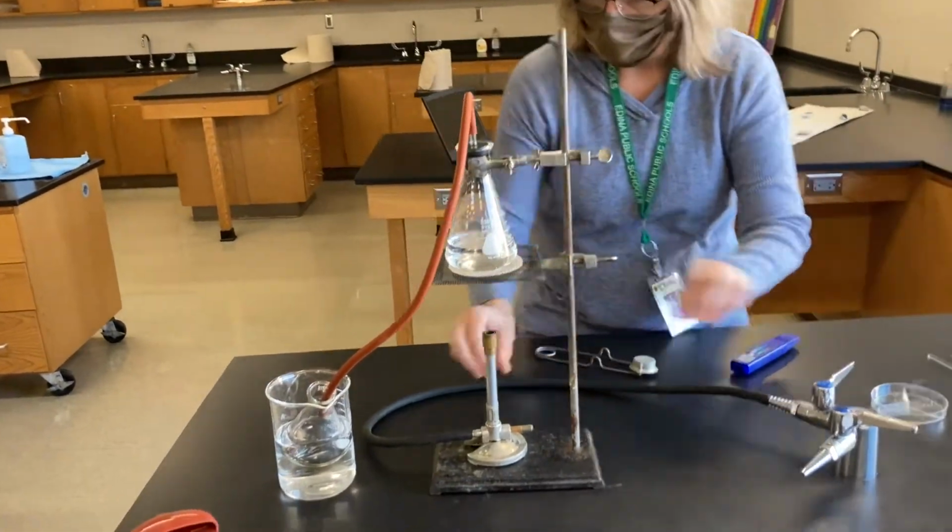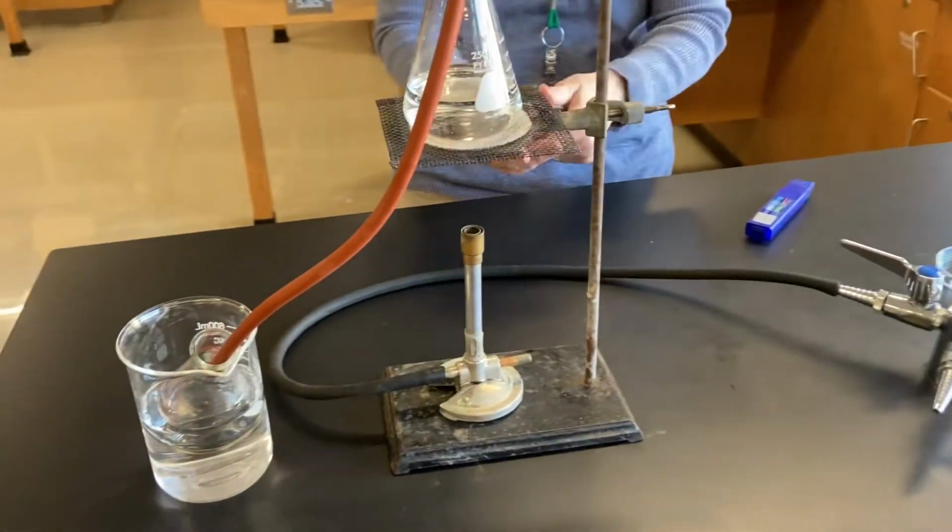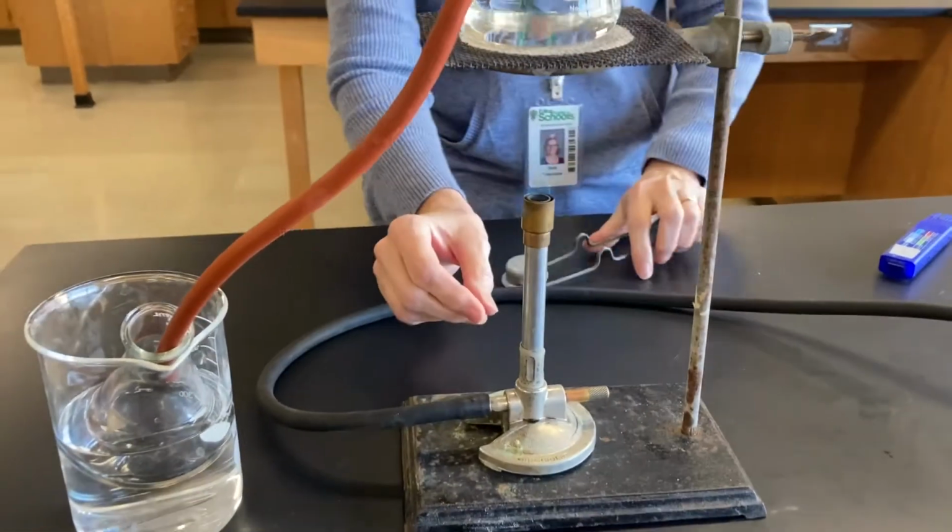Okay, so let's get the Bunsen burner going. We got to get that Bunsen burner going. This will be fun to watch. All right. Okay, here we go, everyone.